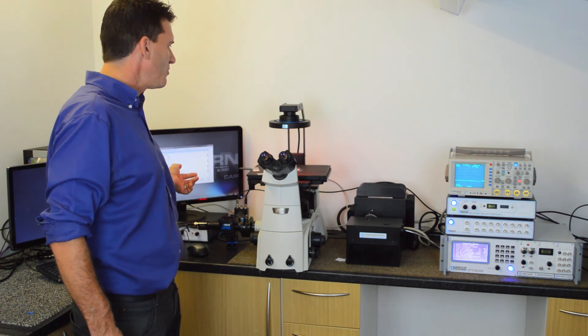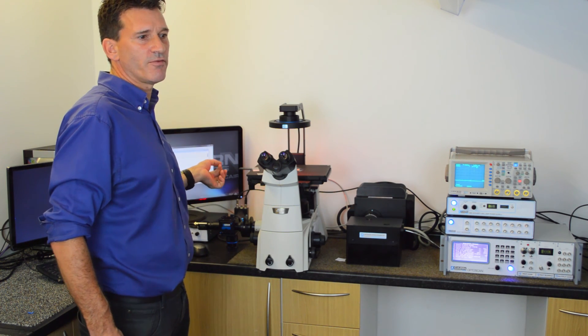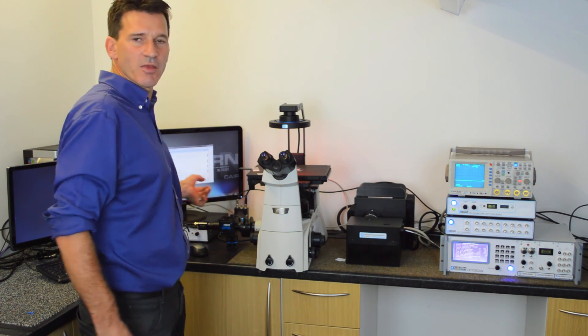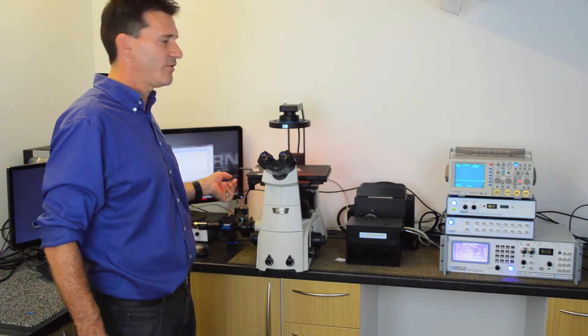You could equally well use pCLAMP or HEKA software, or any other software that's capable of digitising analog signals.